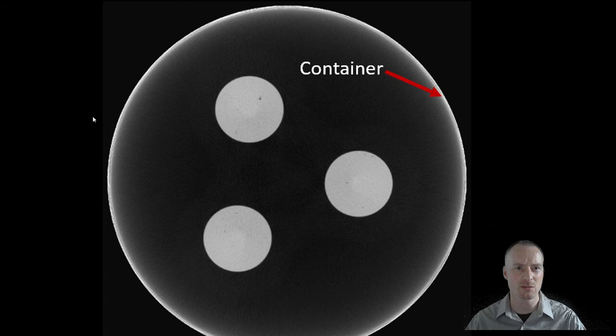In X-ray computed tomography, beam hardening is a particular problem. When beam hardening occurs, the outside edge of the specimen will appear very bright, and as you move towards the centre of the specimen, the grayscale values will decrease and then increase again as you approach the opposite edge. When the beam hardening correction has been correctly applied, the grayscale value should be uniform across the specimen. This makes picking out the pores within the matrix very easy.